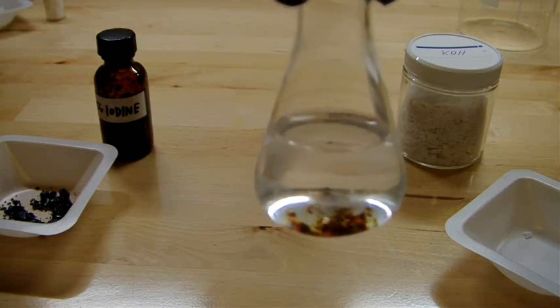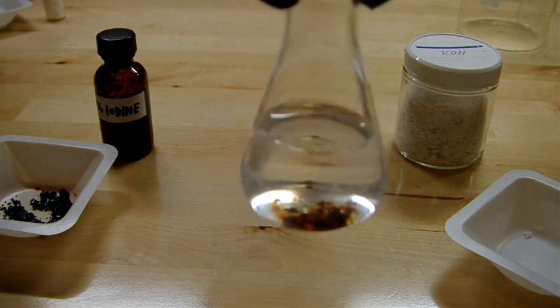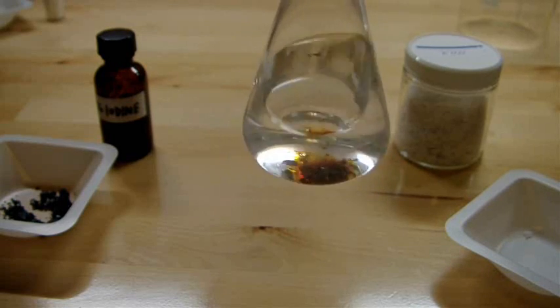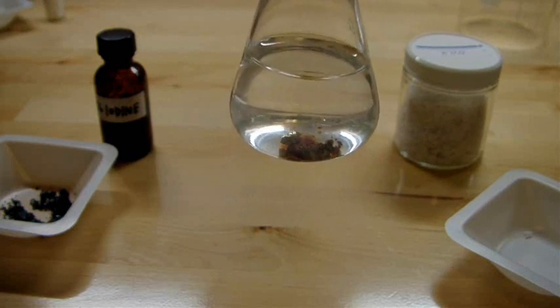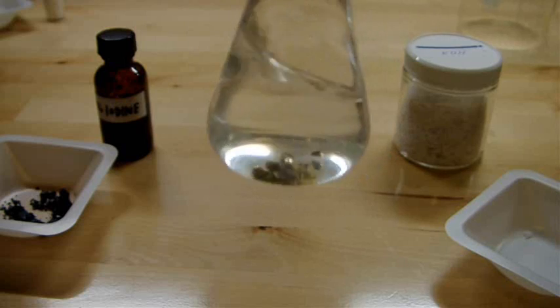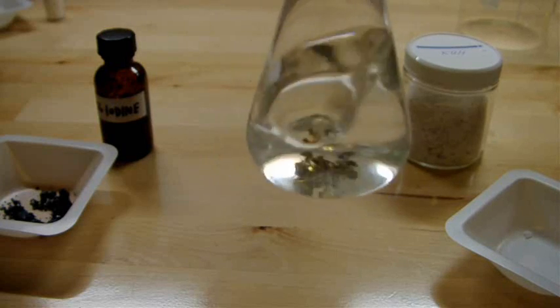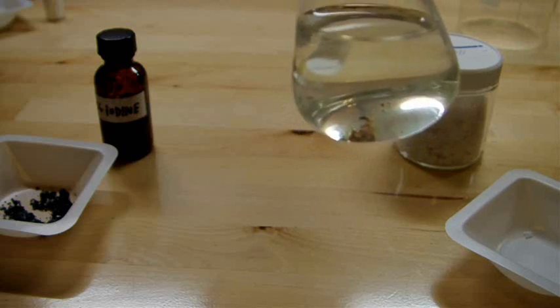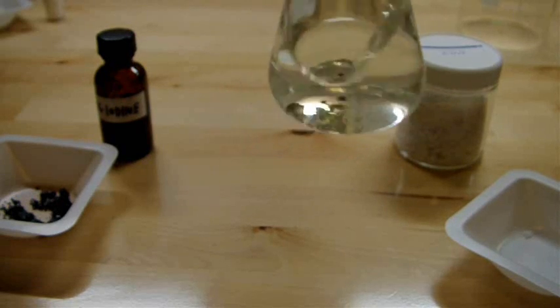Now you can see bits of iodine dissolving into solution. And you can watch the color sort of dissolve away into solution.